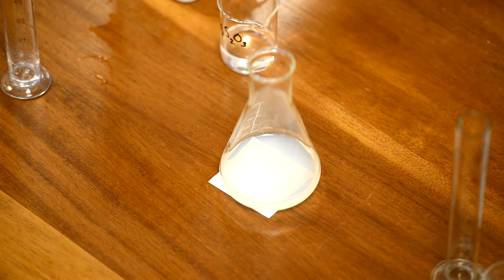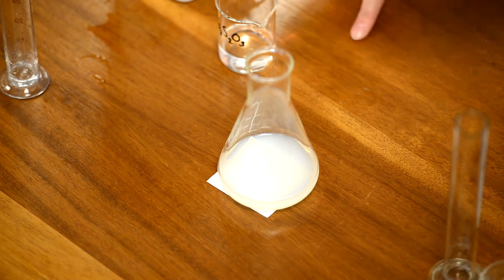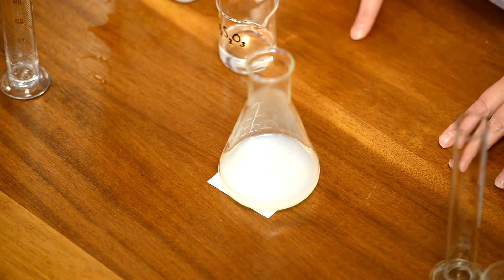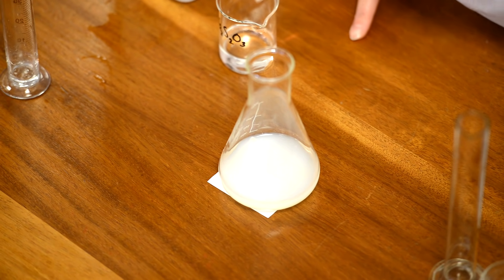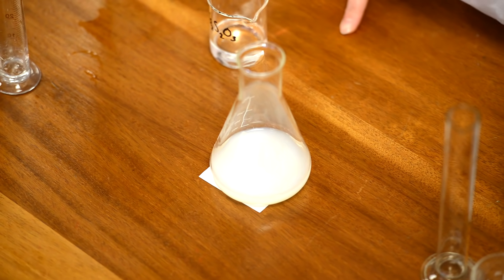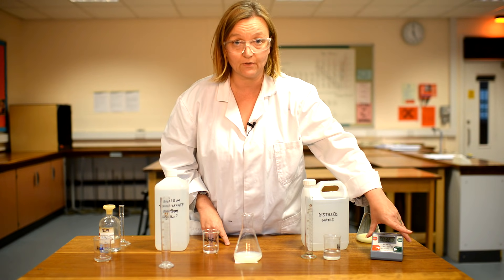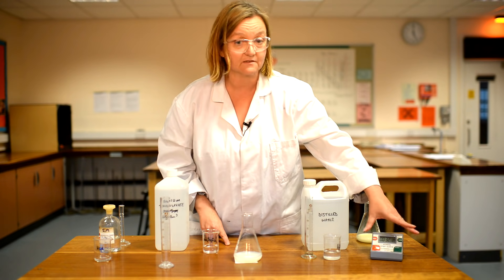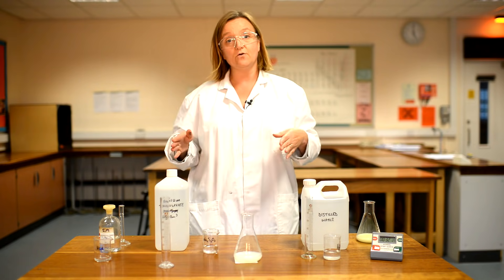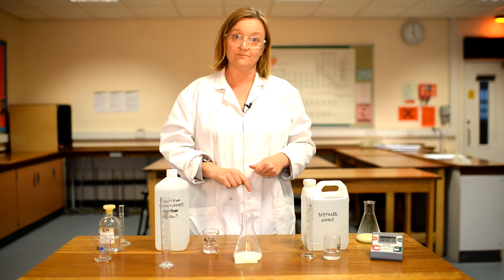The precipitate is appearing at a slower rate. The time is longer and as I watch from above the cross has disappeared — this time at 32 seconds. So the reaction time is longer, meaning the rate is smaller.